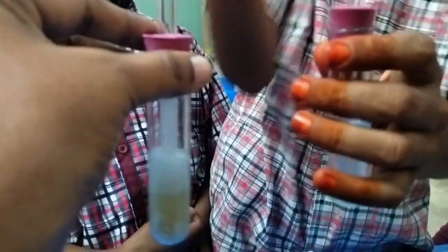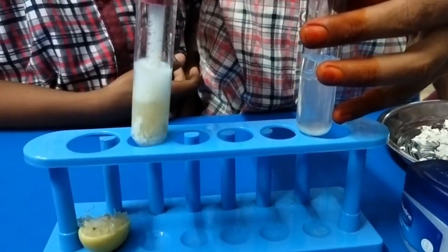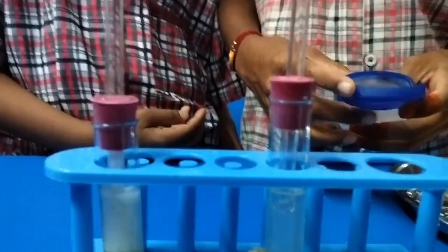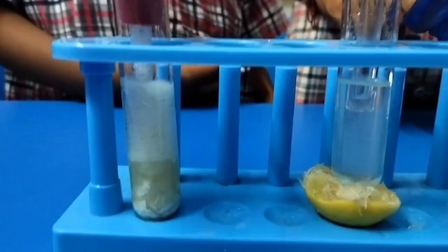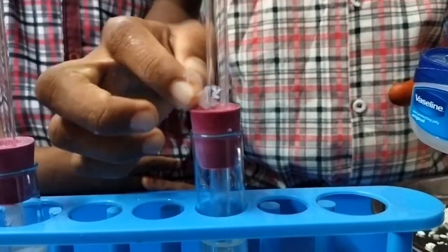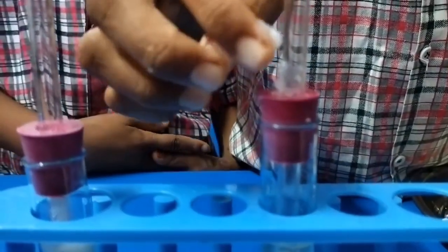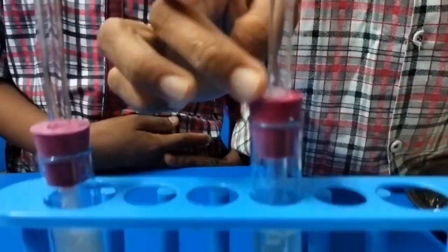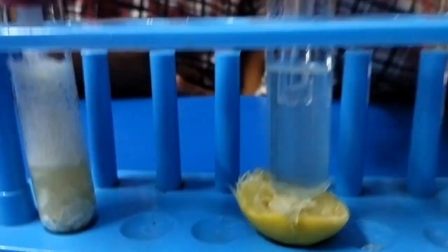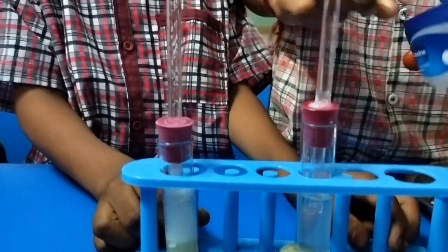You can see the gas bubbles in the lemon juice. That gas will transport through this U-shaped glass tube and will be released into the lime water. To avoid the escaping of gas, we should apply the vaseline around the openings or around the holes, like this.